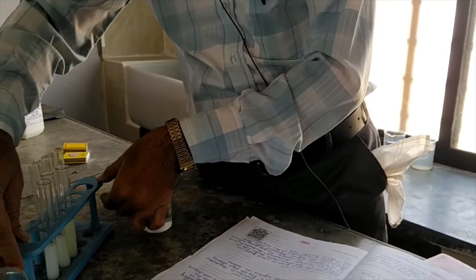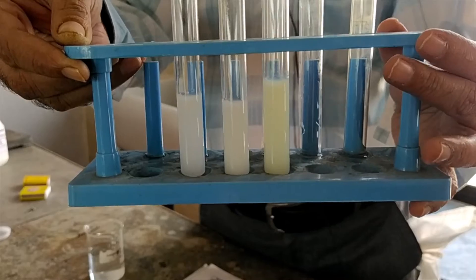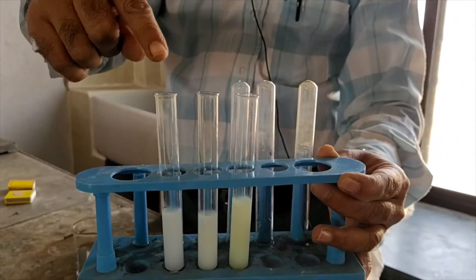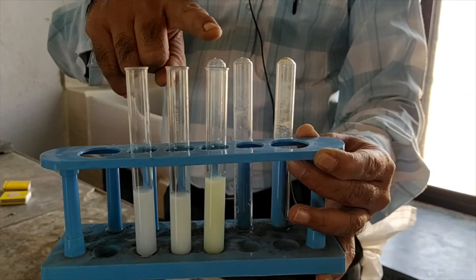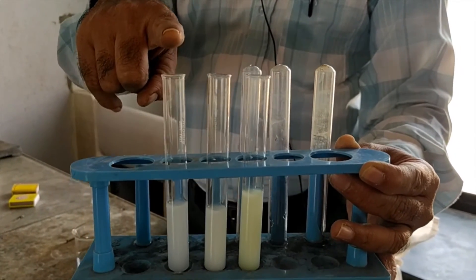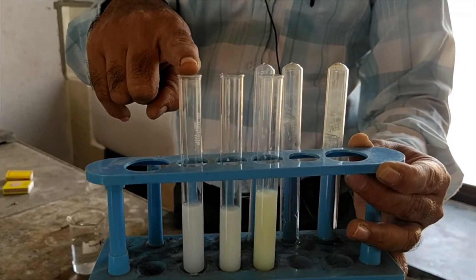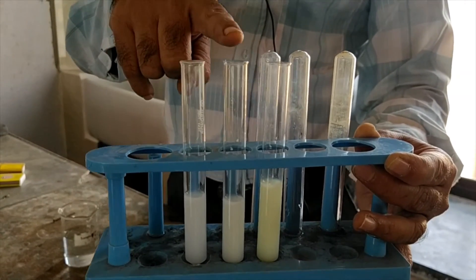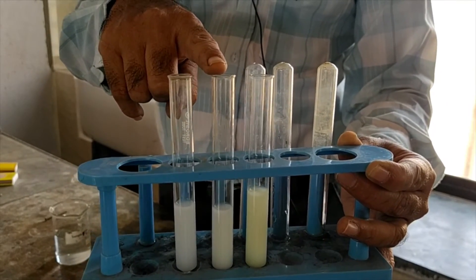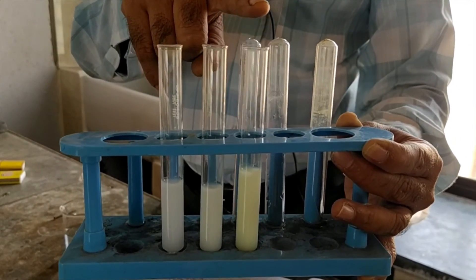Now observe all three colour changes in the test tubes. You will see which is white, which is pale yellow, and which is dark yellow. The first test tube is white — this means the chlorine ion is present. The second test tube is pale yellow — the bromine ion is present. The third test tube is yellowish in colour — here you conclude that the iodine ion is present.